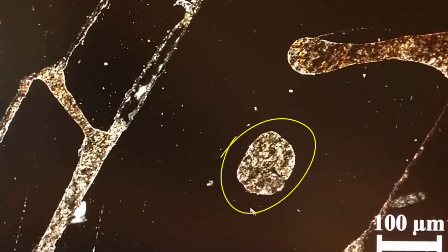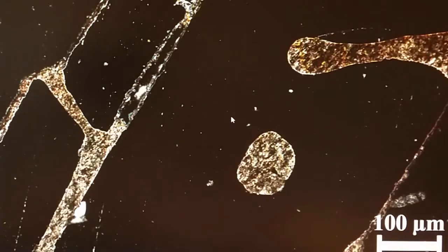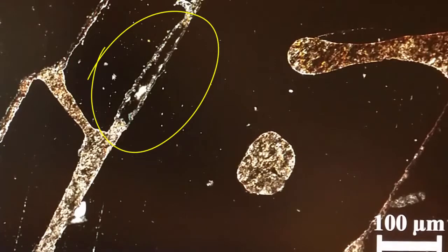The silver looking thing around, that's the aluminum that's been used in this process. And what we want to do in this particular sample was to study the distribution of this aluminum and see if it completely fills the pore or if there are empty spaces like that you see in this picture.